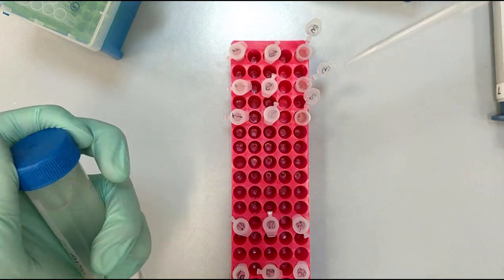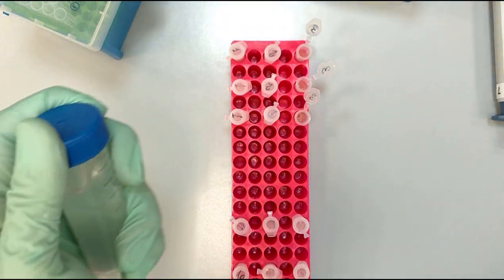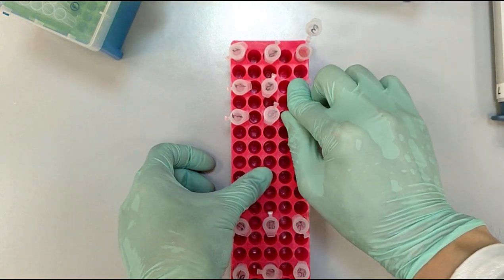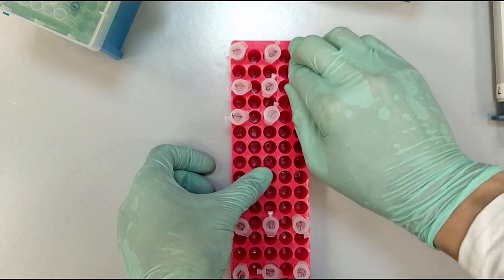We transferred all the solutions to the corresponding eppendorf tubes. Now we switch to the manipulations.